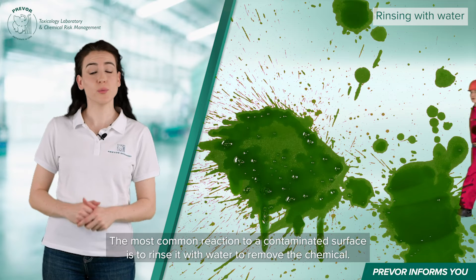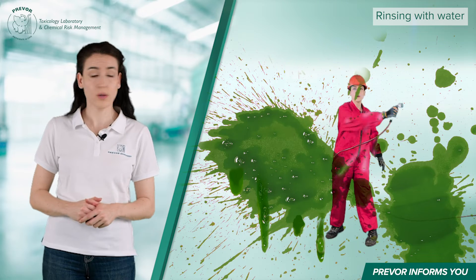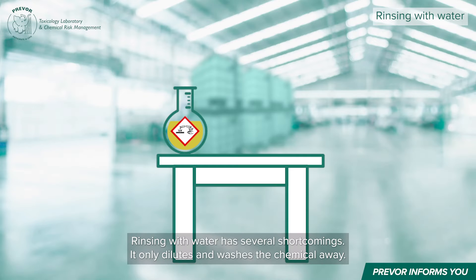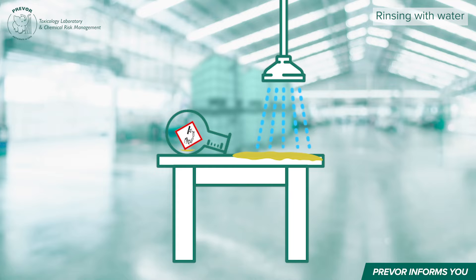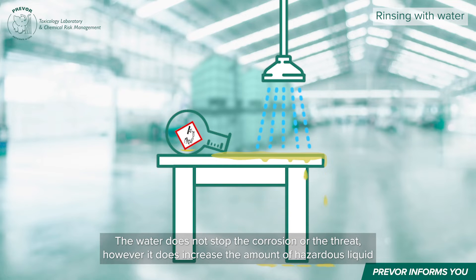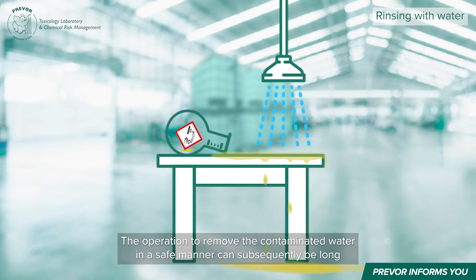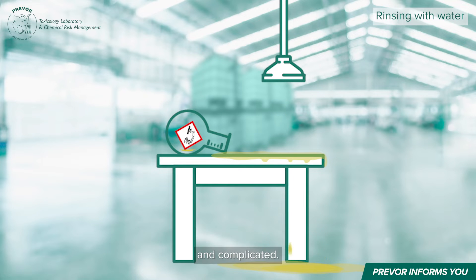The most common reaction to a contaminated surface is to rinse it with water to remove the chemical. But stop! This most common reflex is often insufficient. Rinsing with water has several shortcomings: it only dilutes and washes the chemical away. The water does not stop the corrosion or the threat. However, it does increase the amount of hazardous liquid and expands the contaminated area.